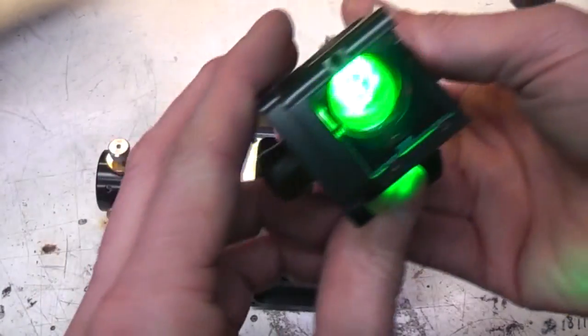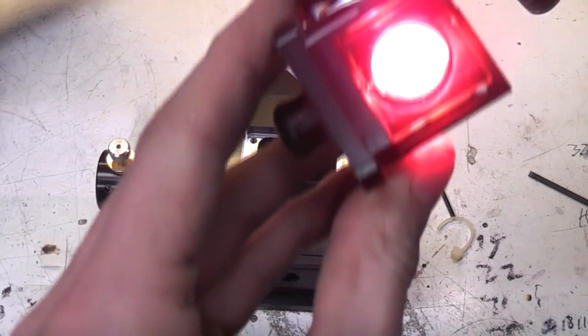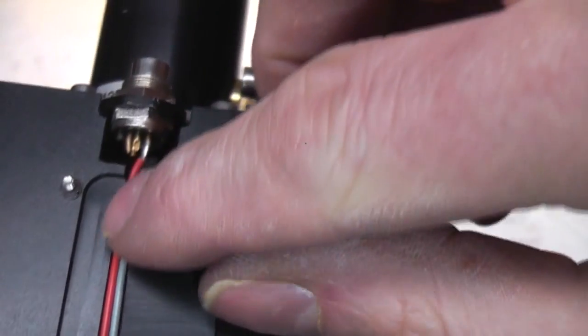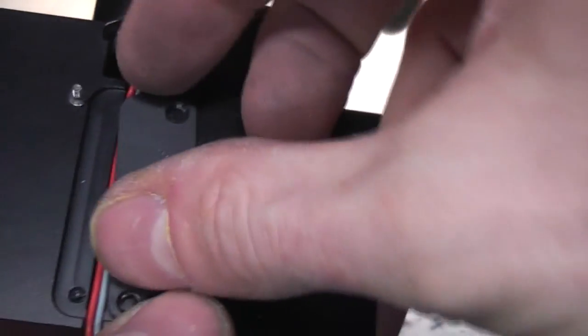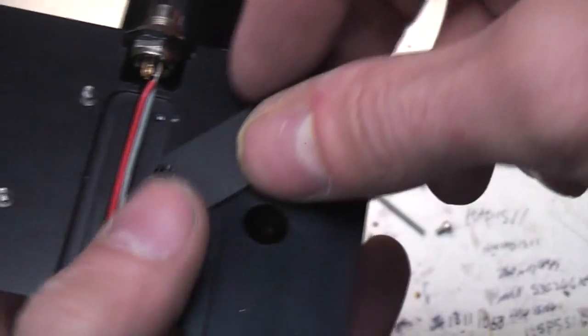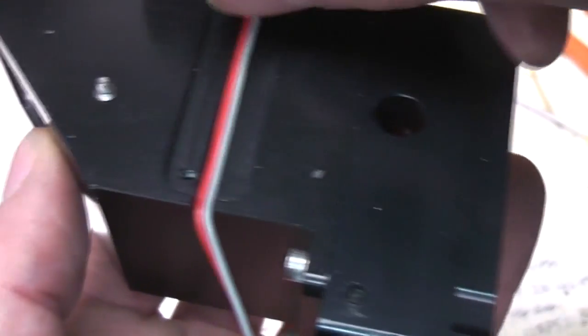Again, this might have just got wet, it might have been water damage or something. Yeah, so the green passes straight through that mirror, the red gets reflected by it. Another little detail of design overkill, just to run this wire down here. They've actually sort of machined out a section and done this little plate that screws in, whose sole purpose in life is to keep this wire hidden. Most people would just use a cable tie.